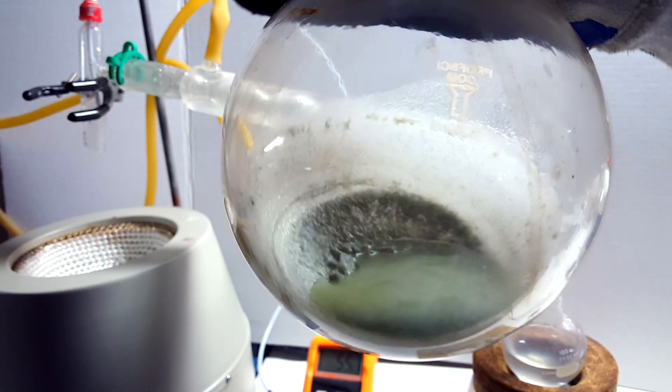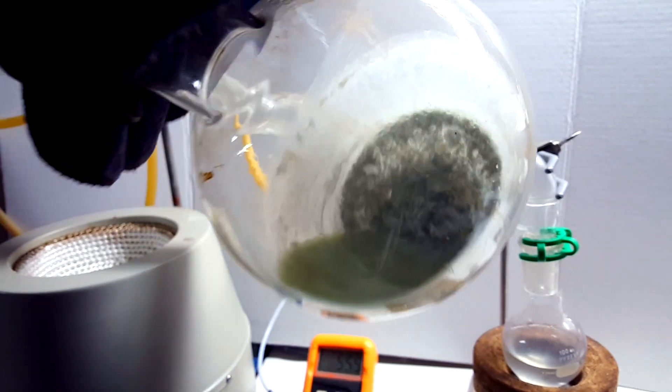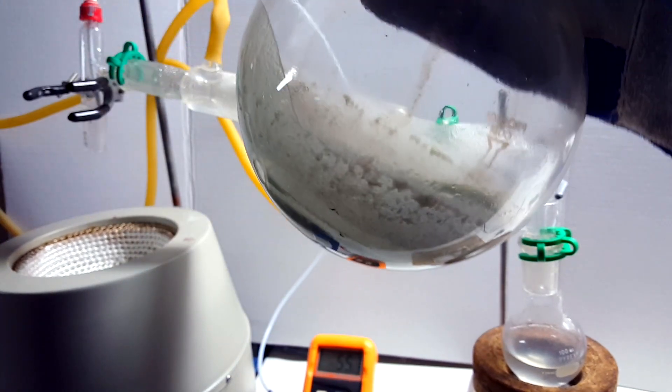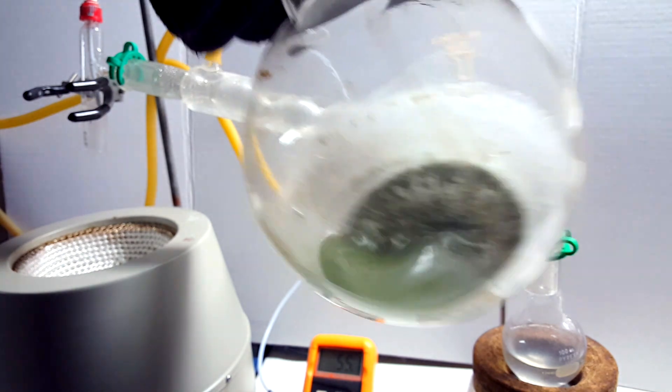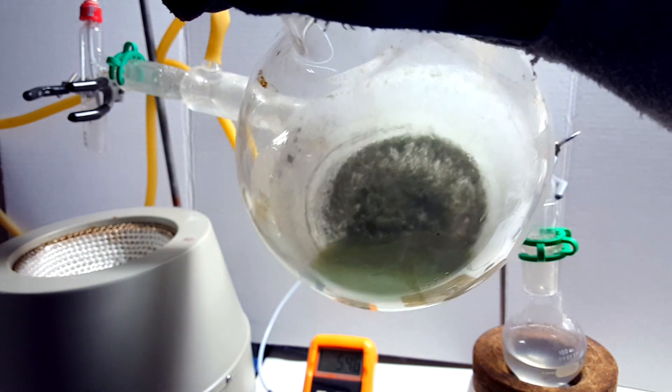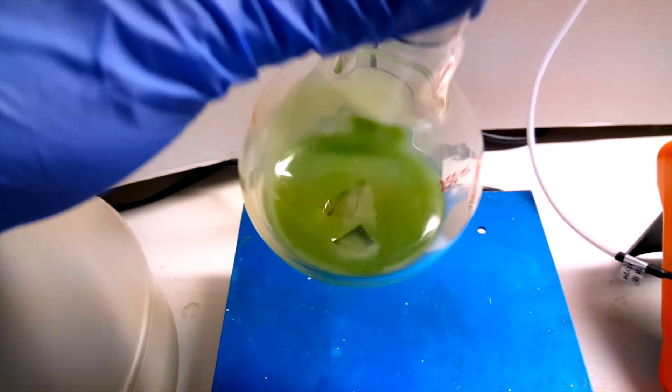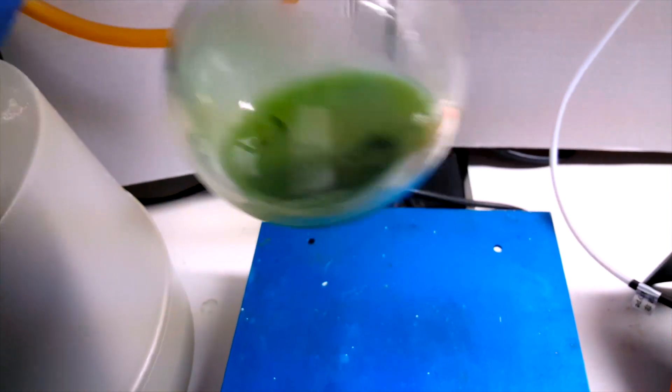Once cooled to room temperature, I explored the distilling flask. Like the first time I performed this distillation, there was a large amount of solids stuck at the bottom of the flask. I suspect these may be polyphosphoric acid derivatives of a larger chain that attached to the glass. I transferred over the liquid to a smaller, flat distilling flask for a hot plate distillation.